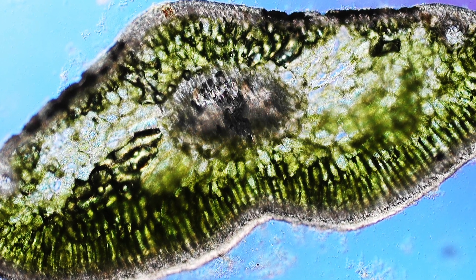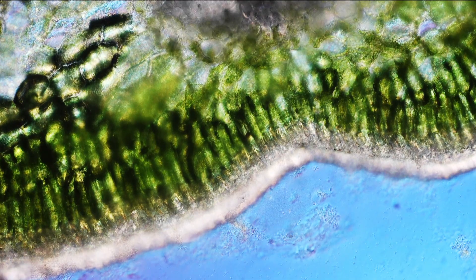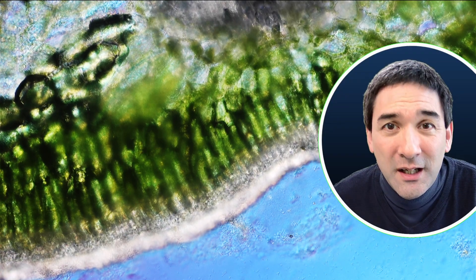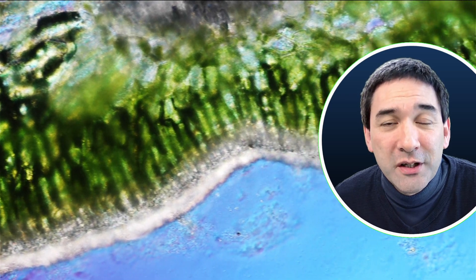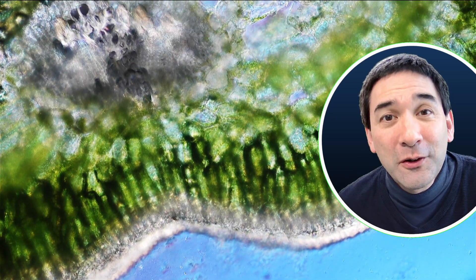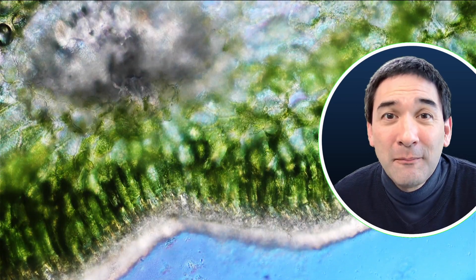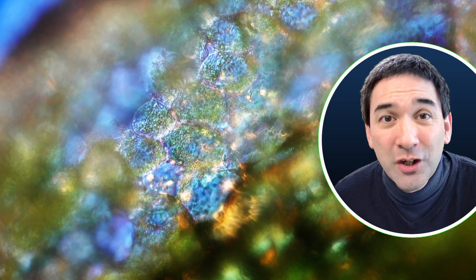We can see already that the color of the cross-section is not the same everywhere. The central part, for example, is responsible for transporting water, and it's not green because the green parts are the ones that actually do photosynthesis. The top surface is significantly greener than the bottom surface. It's characterized by longitudinal cells stacked like columns, referred to as the palisade layer or palisade mesophyll. It's very green because it points upwards towards the sunlight, making it very efficient at catching light.